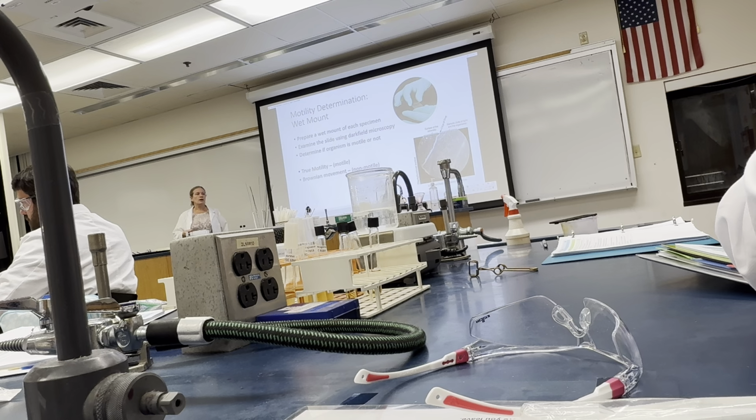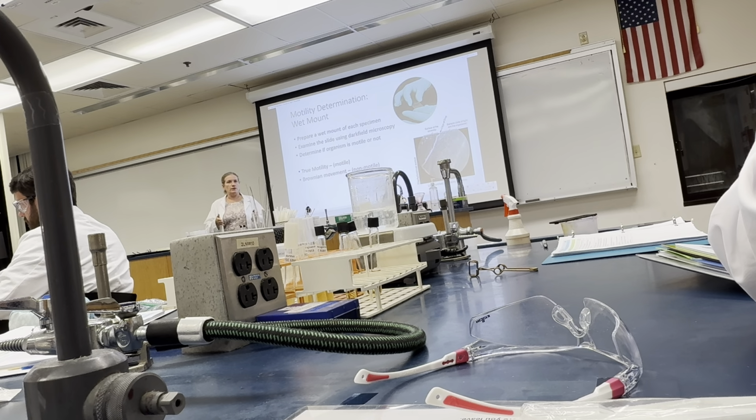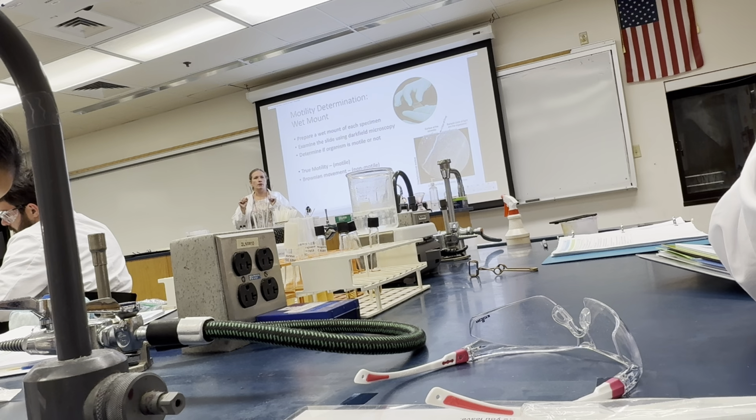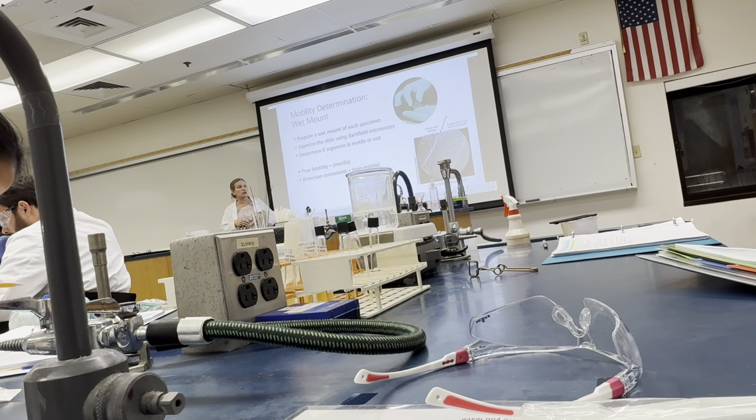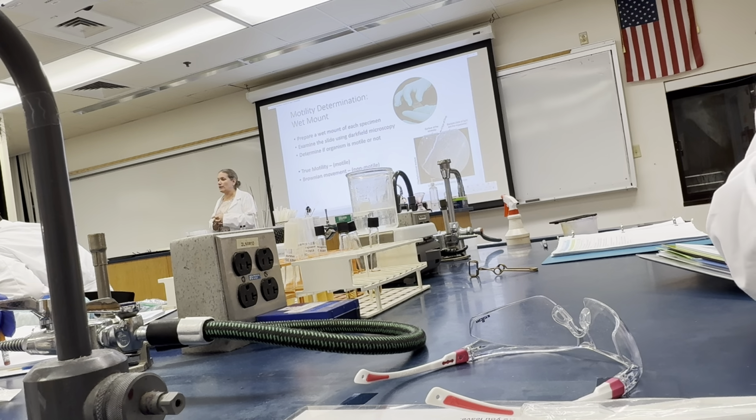At 20x, Proteus mirabilis is a rod. Staphylococcus aureus, you already know, is a coccus. And you can actually tell the difference. One looks like a rod, even though they're very small, they will look like a rod shape for Proteus, and the other one will look like twinkling stars, right? So, the question then becomes whether you're making that determination of true motility or Brownian motion. If I get called over to your table, that's all I will do, to make sure you have it in focus.